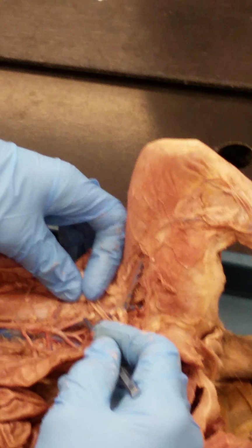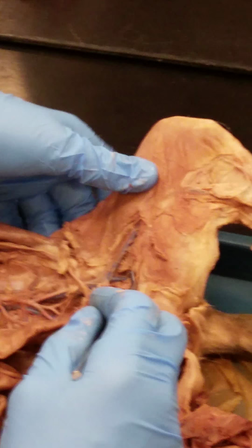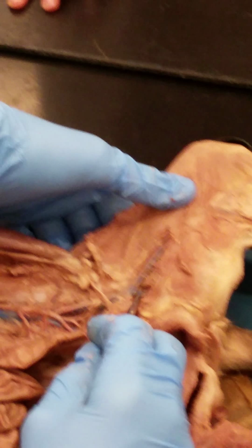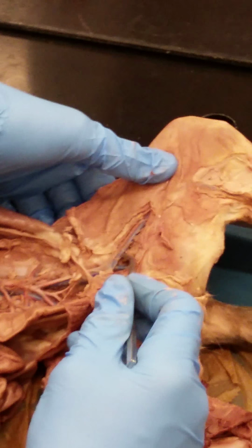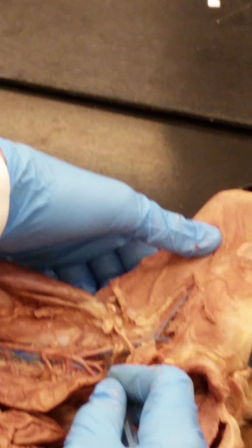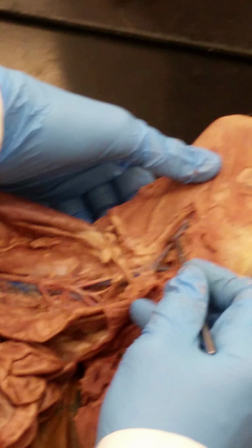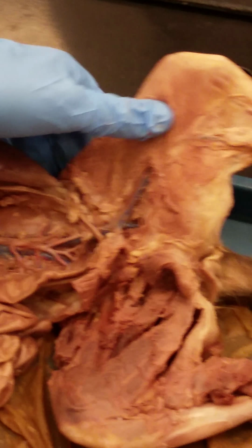And if we follow that common iliac vein out to here, again, this is a lovely kitty. You can actually see very clearly where it divides, and this is your internal iliac vein, and this is your external iliac vein. But it's not branching till out here. This would be the common iliac vein. Once it's out of the body, then it becomes the femoral vein, and your external iliac artery becomes the femoral artery. Did I leave anything out?